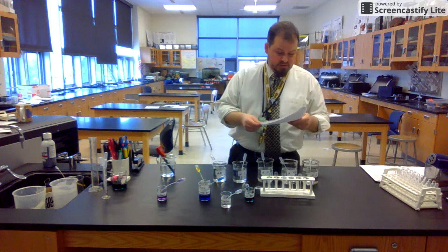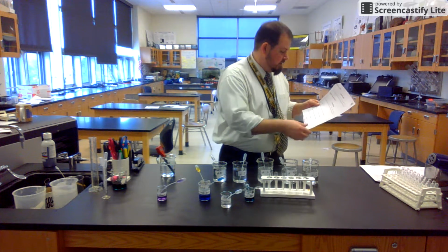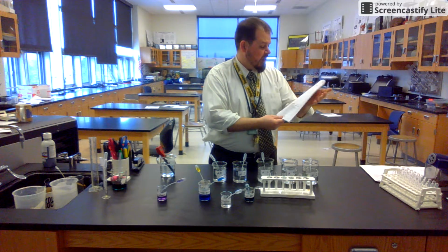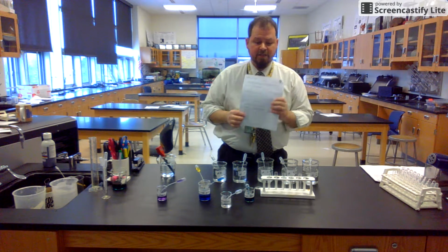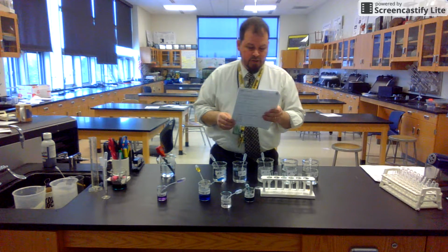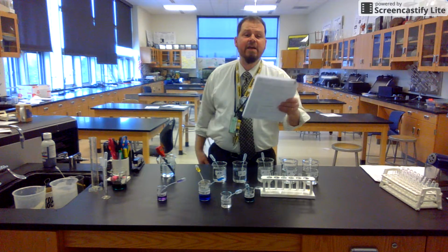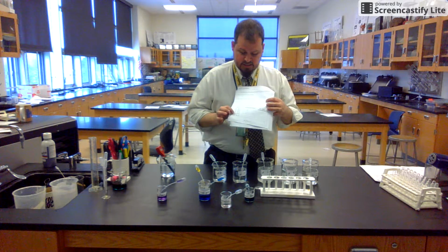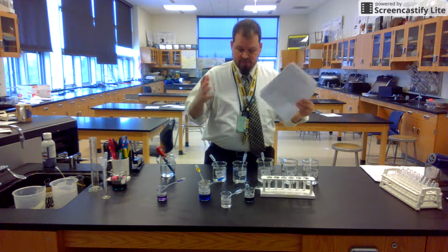All right, next piece. We have some analysis questions that are based on the data that we just took. We can do those. And then there's this little last piece about pH. So on the very last one that you do, let's say it's phenolphthalein because it's the last one you do. You do need to take one other precaution on this data table here, and I wish that they were kind of together, but they're not.